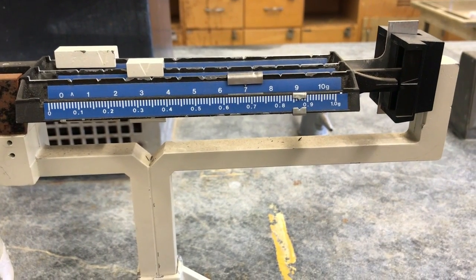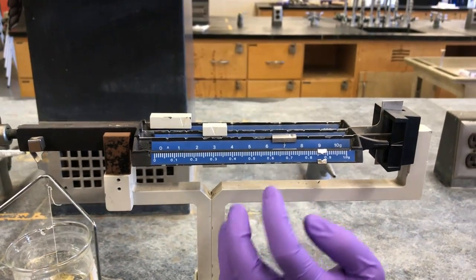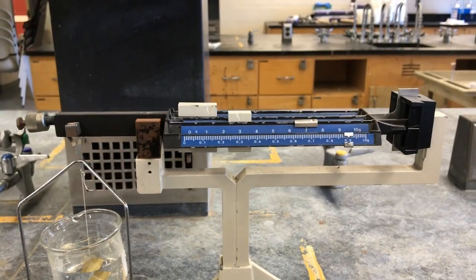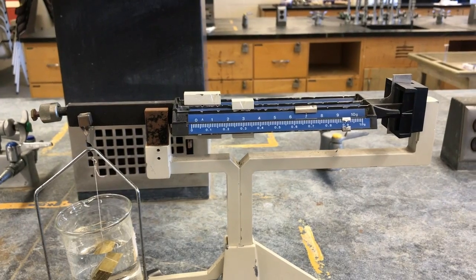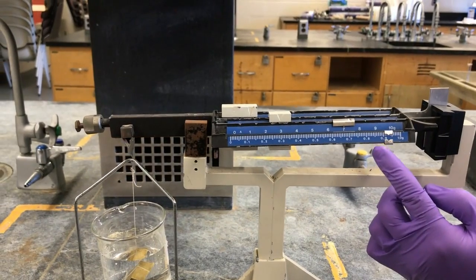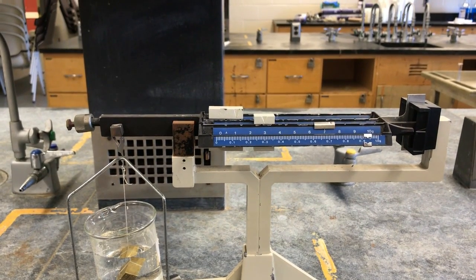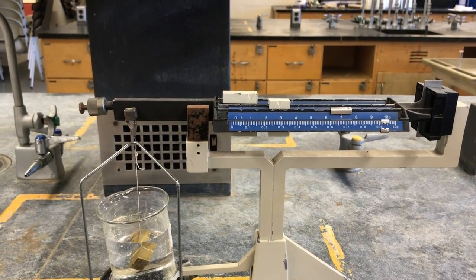Nailed it. That's good. I think it looks good to me, from this angle at least. How about straight on? From straight on, it's a little bit off. That's why the angle where you're standing really matters. You want to look at it like you're looking at a meniscus. I think that should be good.